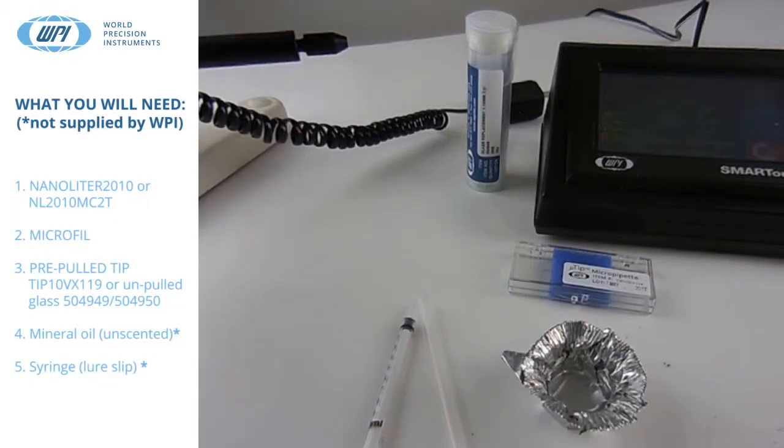Process to fill a micropipette using the Nanoliter injector. What you will need.